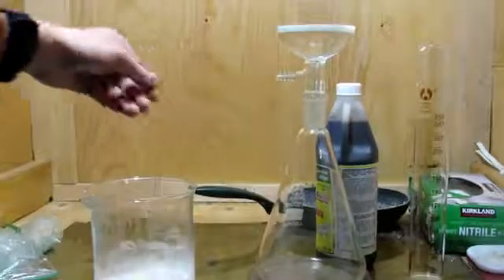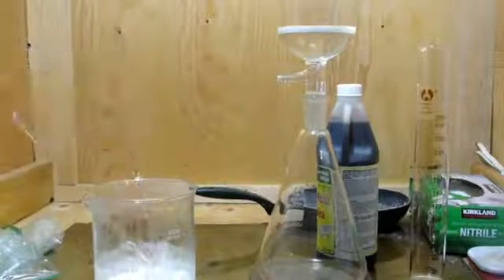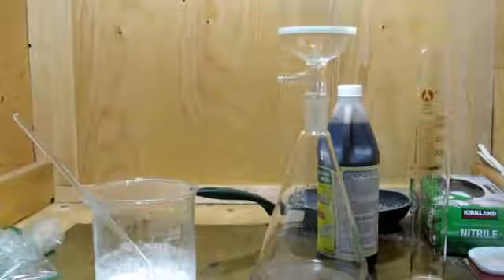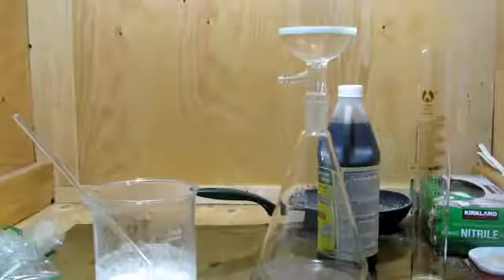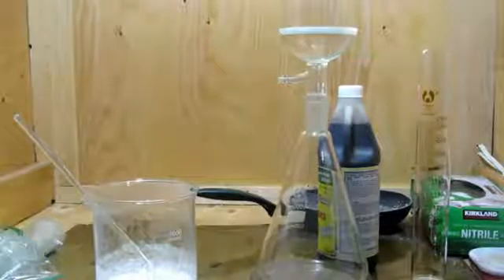Now, as can be seen here, I am using a vacuum filtration, as the solution is somewhat viscous. Even after adding that extra water, it is still relatively viscous, and a gravity filtration would take quite a while.